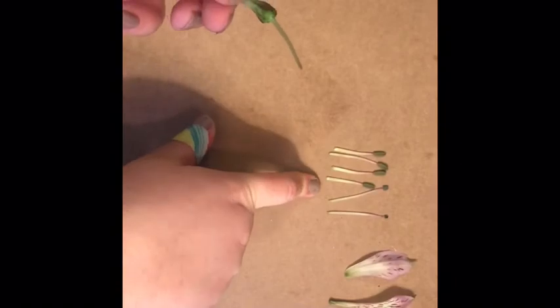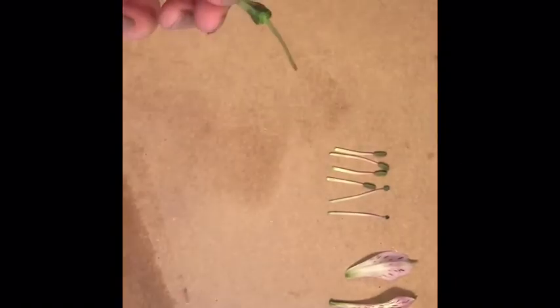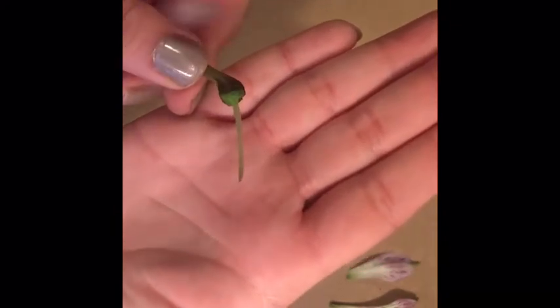So this whole part here is called the pistil. And at the very top, which is really difficult to see, there are some grooves, and that is the stigma, and that is the part that accepts the pollen. So if a bee is buzzing around, it would land on our friends here first because they are sticking up at the top, and then they would fly to a new plant, and they would carry the pollen that they have collected on their fur and on their legs, and they would deposit it here.